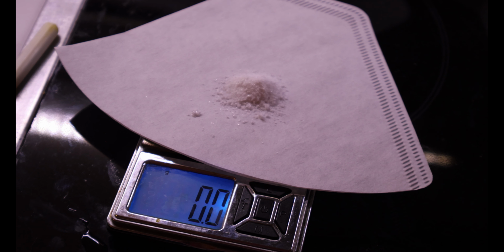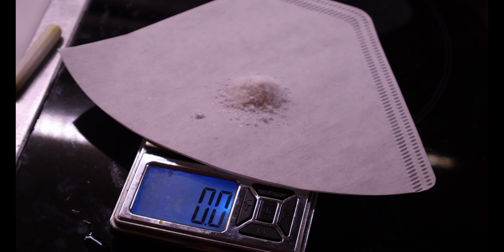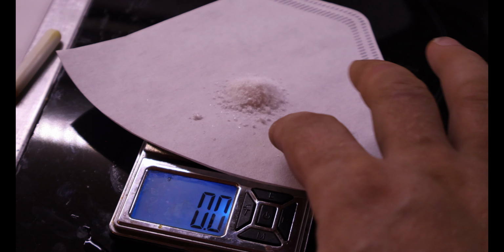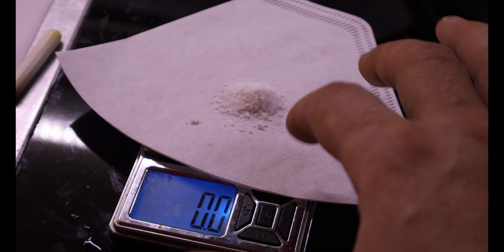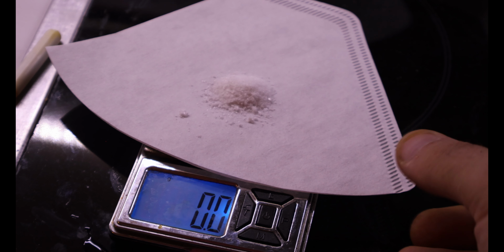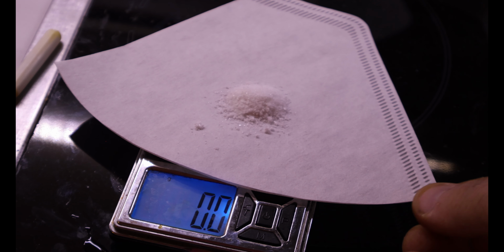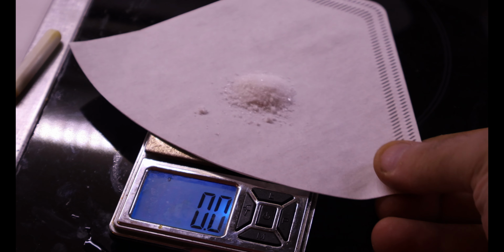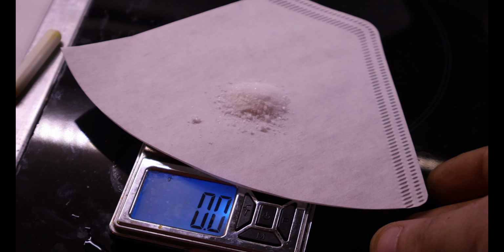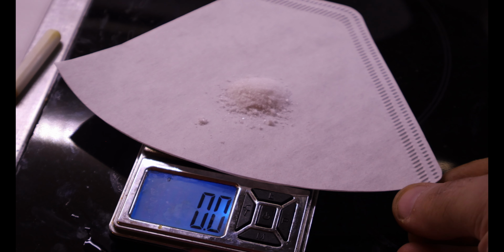There you go, people. Oops, what happened? It said half a gram. I saw it. I know you saw it too. Where's my gram? Hey, don't steal. Don't cheat.